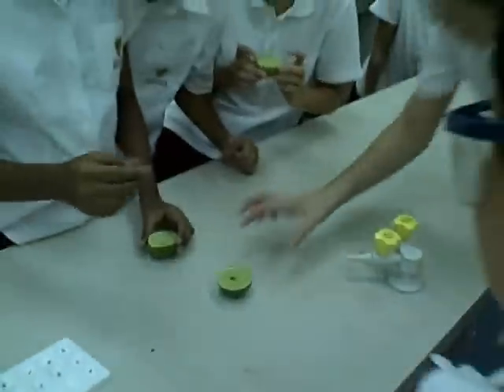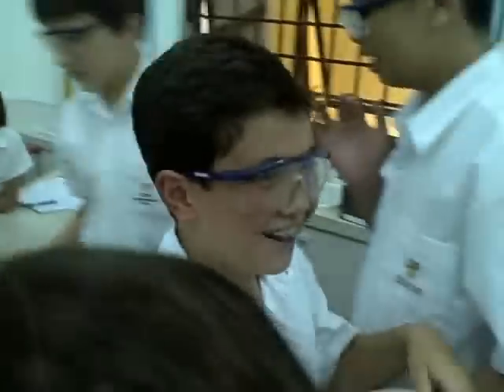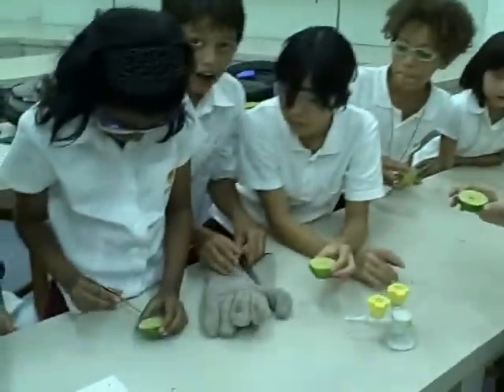Crazy. Oh, yes. Yeah. This is absurd. Yeah, it's okay. Okay. Put it on the floor. I just have my phone. That's happy. Awesome. Yeah.